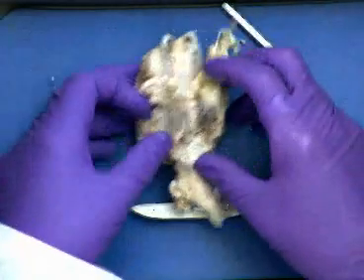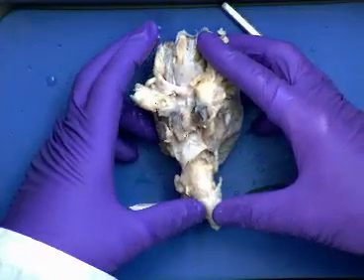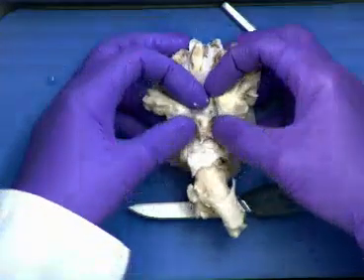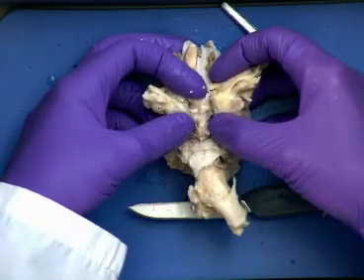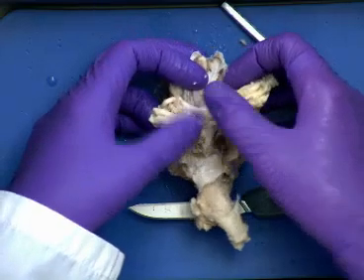A couple other things that we can see. We're now looking at the inferior surface of the brain. So here is our spinal cord down there, and then our brain stem is going to be through here. In this area here, see how between my thumbs right there, there's a bulbous structure. It kind of looks like a pea. That is the pituitary gland. So that's the pituitary gland that hangs off the inferior surface of the brain.